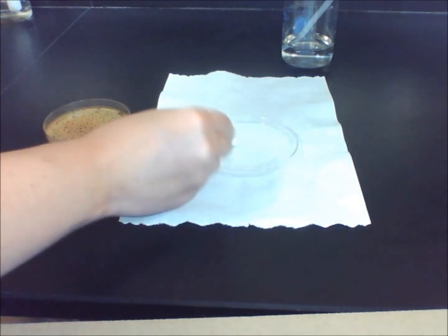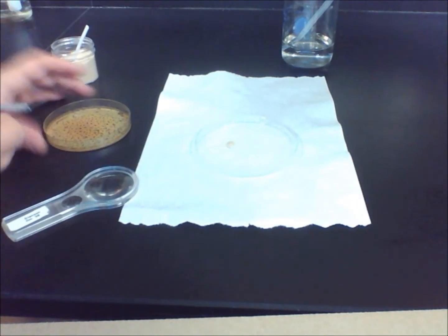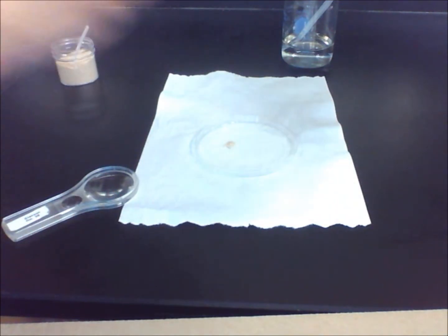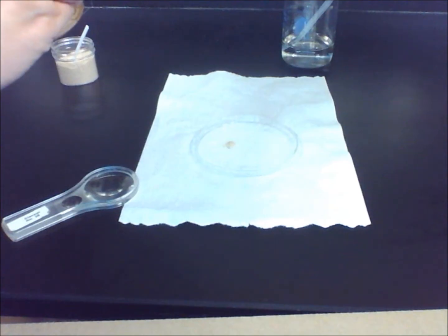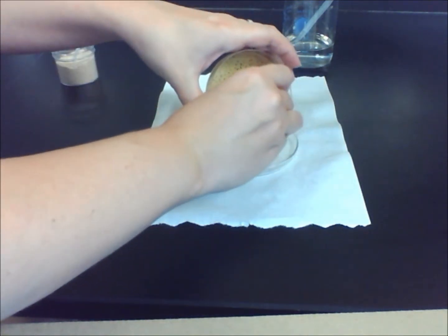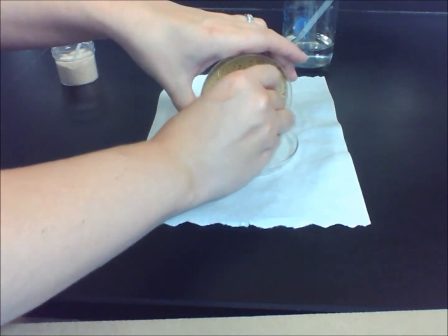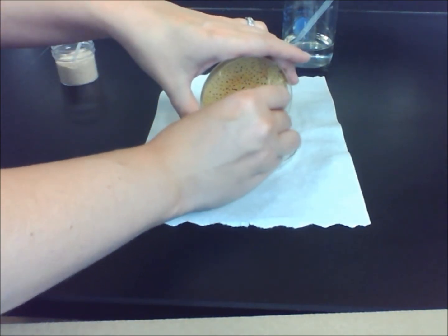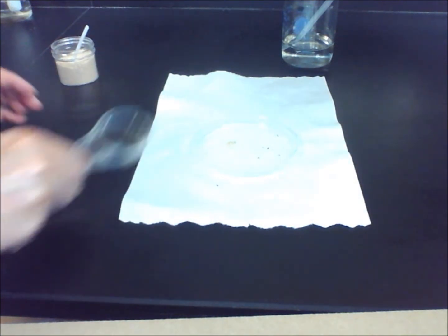The station is focusing on substances that are soluble and insoluble. You will notice that both substance A, the sand, and substance B, the potassium permanganate, are crystals when you observe them. They're different colors — the sand being a cream color, and the potassium permanganate being a dark purple or black.